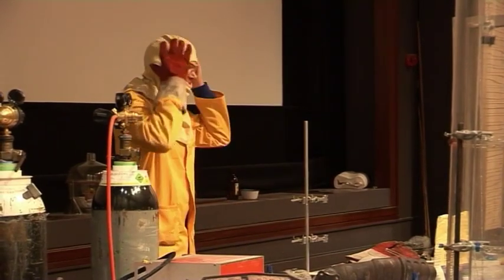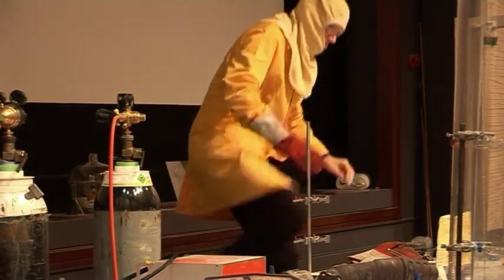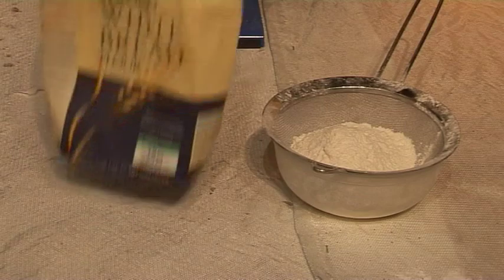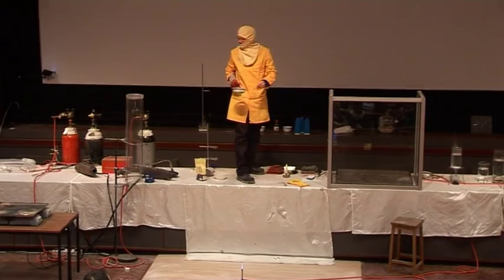So I'm going to burn something particularly flammable now, and this is flour, okay? Alright, if we have the lights down again, please, thank you.